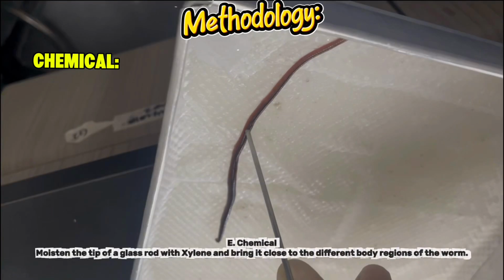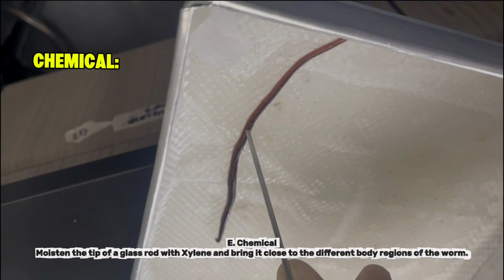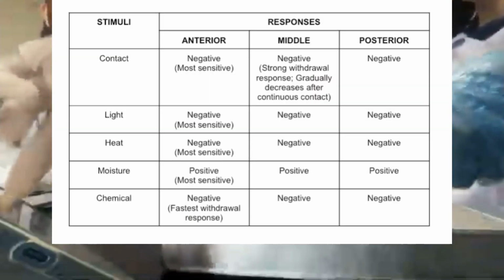And lastly, to test its response to a chemical stimulus, moisten the tip of a glass rod or stir rod with xylene and bring it close to the different body regions of the worm. Xylene, not salt. Here's the summary of our results.